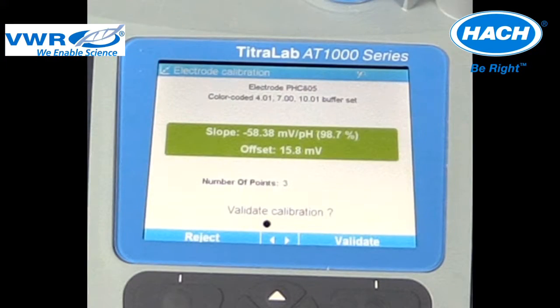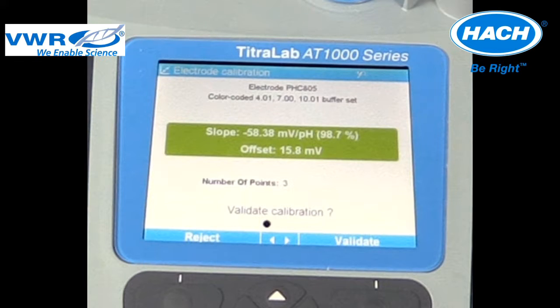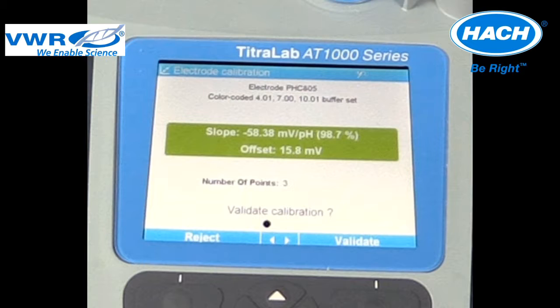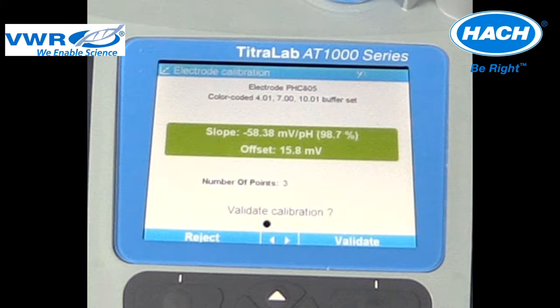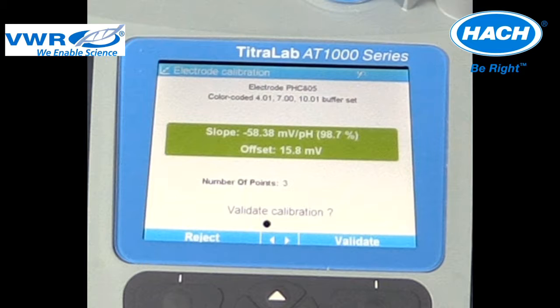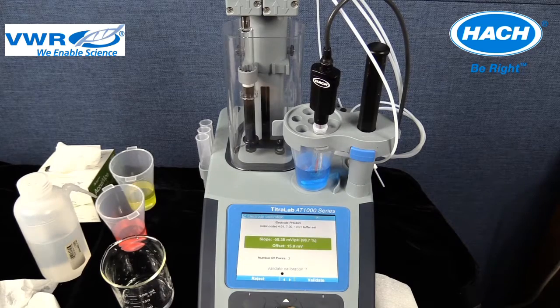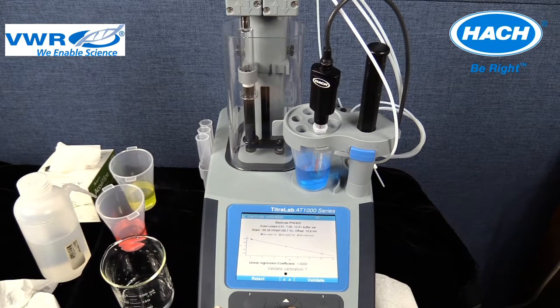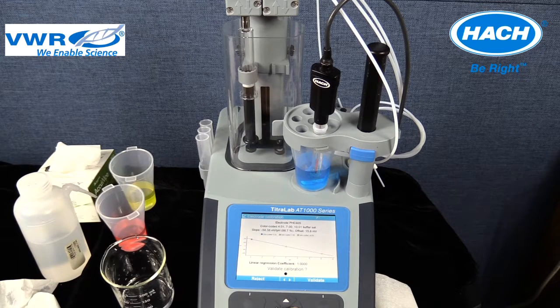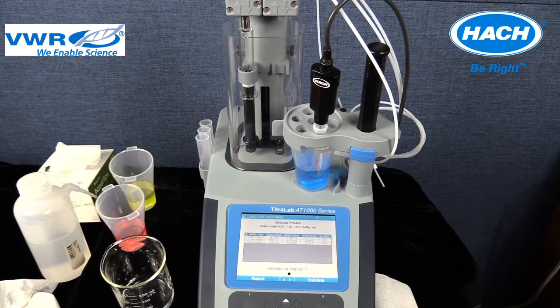The calibration percentage is a calculation of the measured slope divided by the theoretical slope of minus 59.16, times 100. The black dot at the bottom of the screen indicates that there is a subsequent screen of information. By using the arrow keys on the keypad, the second screen can be displayed. In this application, the second screen displays the calibration curve. The third screen is the calibration table.